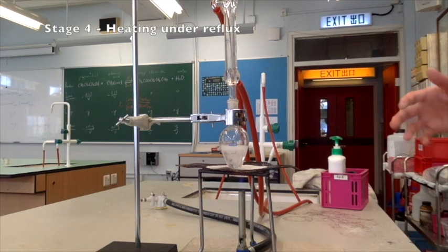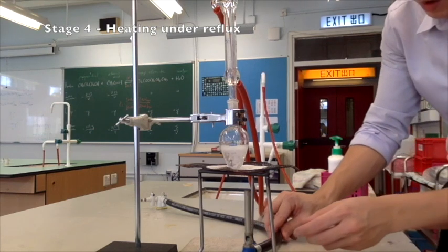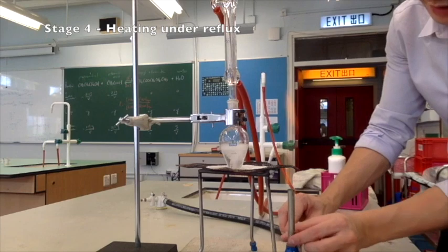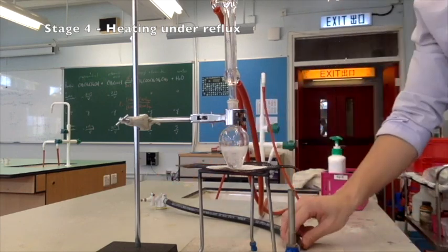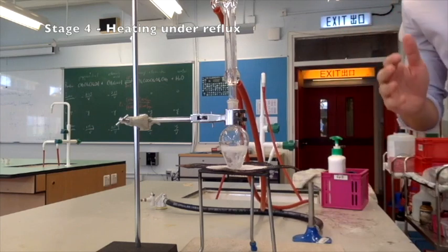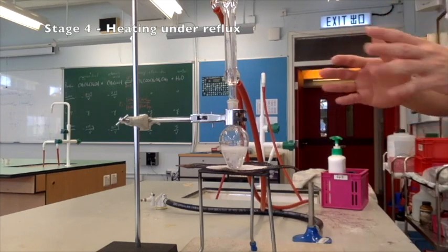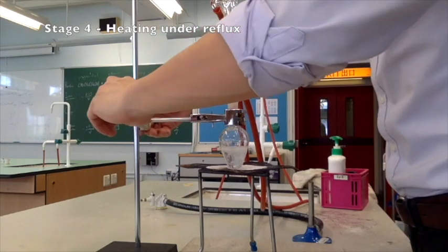Okay, after the mixture has been refluxed for some time, it is time to stop the heating. So we will close the air hole and then remove the heating. We will let the setup cool down in air for a few minutes before we actually transfer it. We can lower the apparatus a little bit.